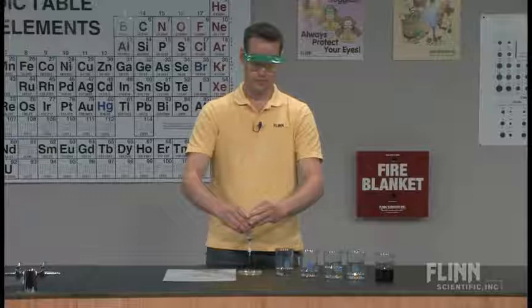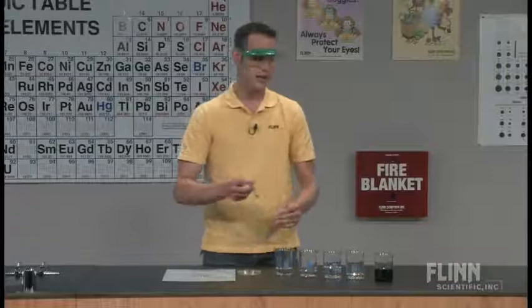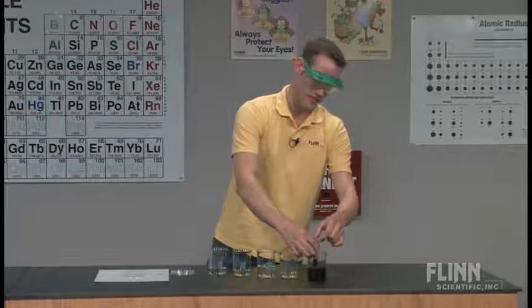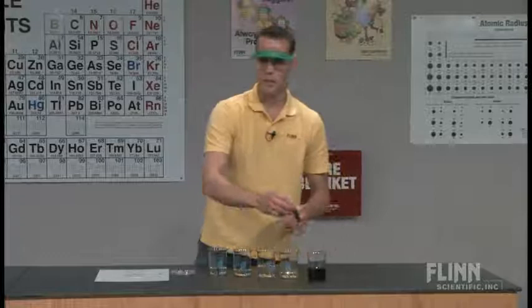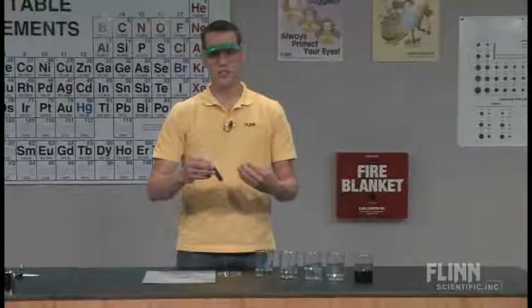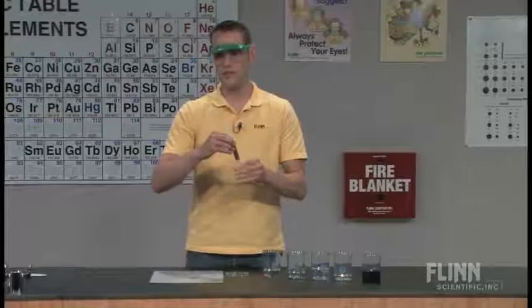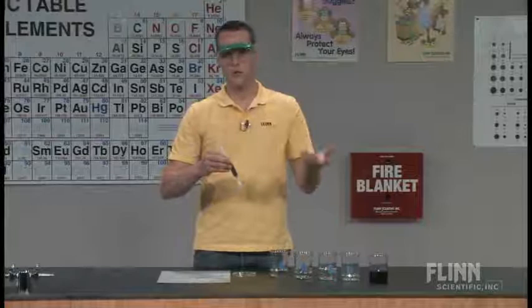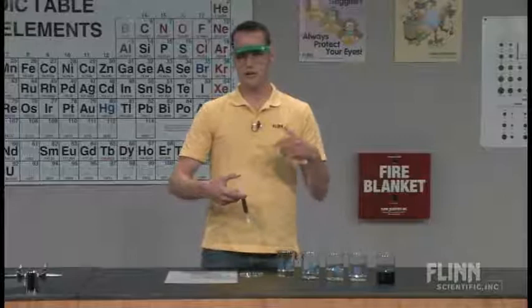I tell them to draw up 10 milliliters of the Kool-Aid solution. Most directions say to prepare it to package directions just omit the sugar. I found if I prepare it a little bit more concentrated, it works a little bit better. They can see the color separation a little bit nicer. So instead of taking two liters to one packet of Kool-Aid mixture, I'll do one liter or one and a half liters. I have tried to store the solution from year to year. It grows mold, so I wouldn't suggest that. Just pour it down the drain and grab a new one the next year.